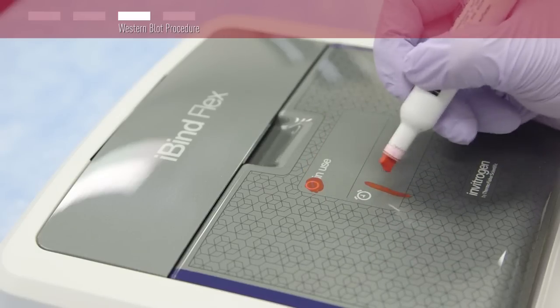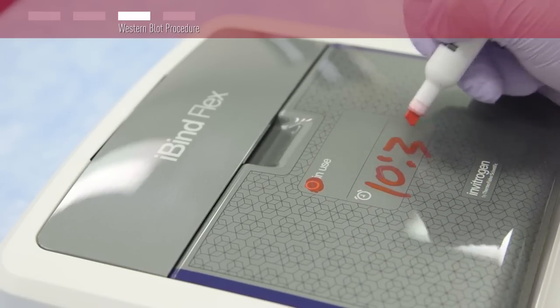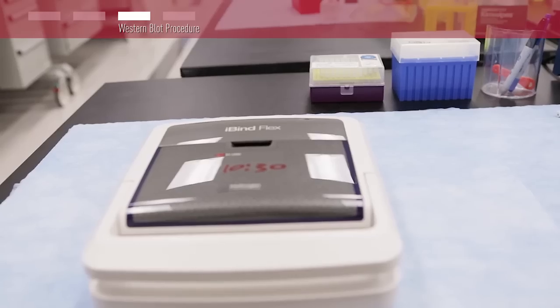Use a dry erase marker to indicate that the device is in use and the start time of the experiment. Now, walk away and get back to your life for the next 2 and a half hours. You can even leave it overnight.